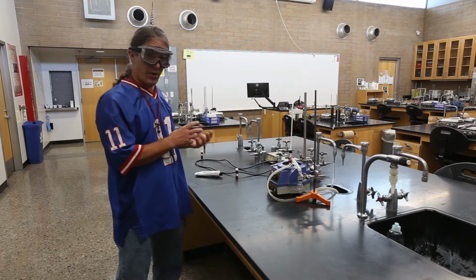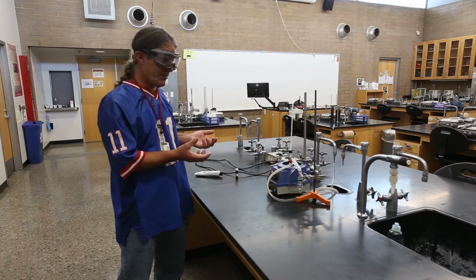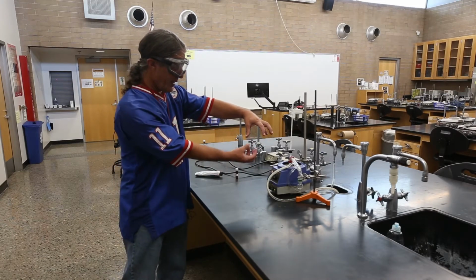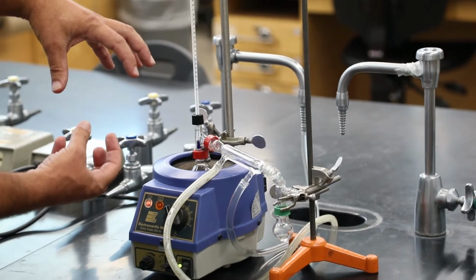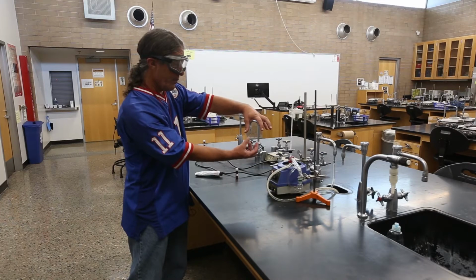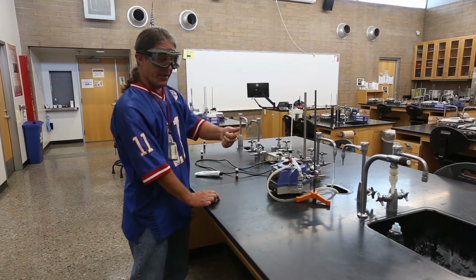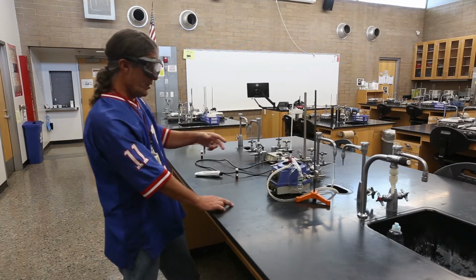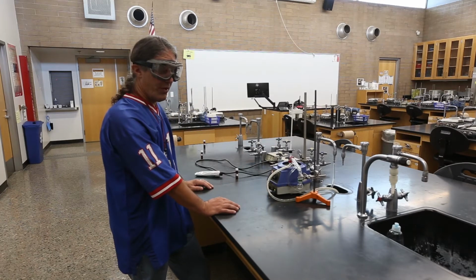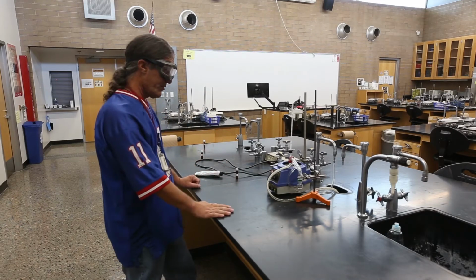Since we know this is hexane, we already know what the boiling temperature should be, but the boiling temperature is going to depend on the atmospheric pressure. So the atmosphere is pushing down on the liquid, keeping it from forming bubbles. The heat is allowing it to form bubbles, and when there's enough heat to overcome the atmospheric pressure, the bubble can form and escape. So the atmospheric pressure is going to depend on your elevation and the weather and a bunch of other things, but the higher the atmospheric pressure, the higher the boiling temperature. Since we're at about 1,200 feet, we're going to expect a slightly lower boiling temperature than the literature says.